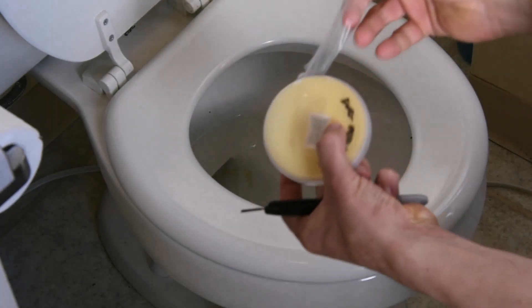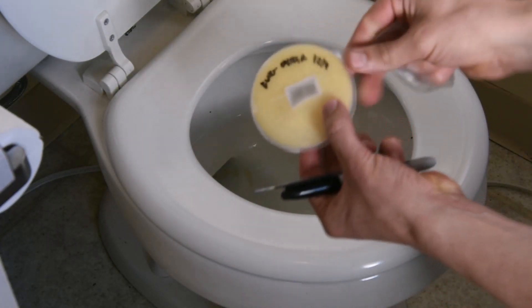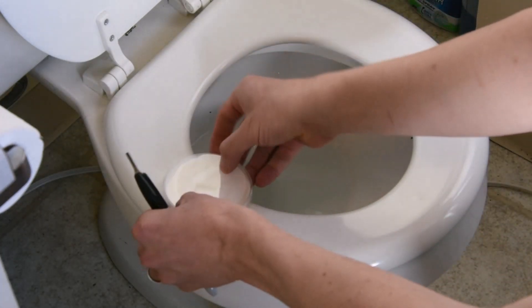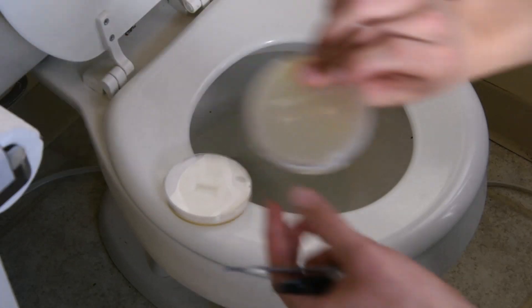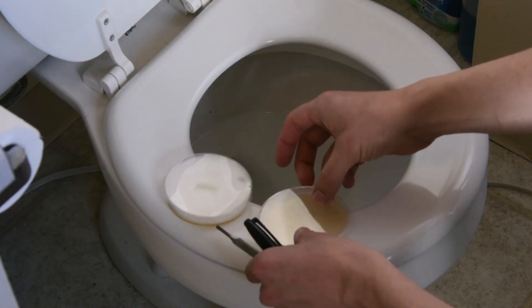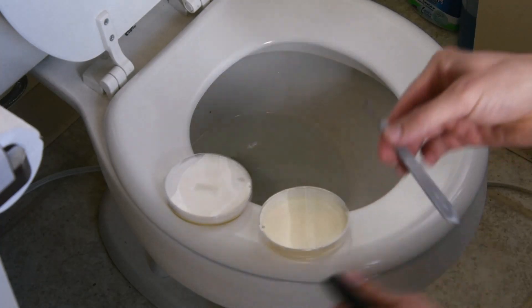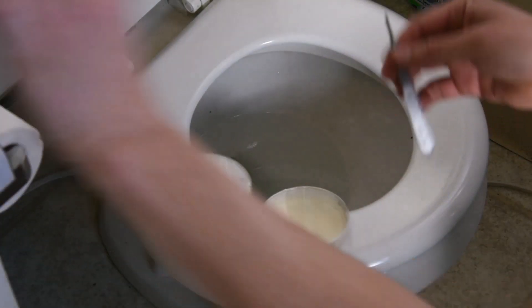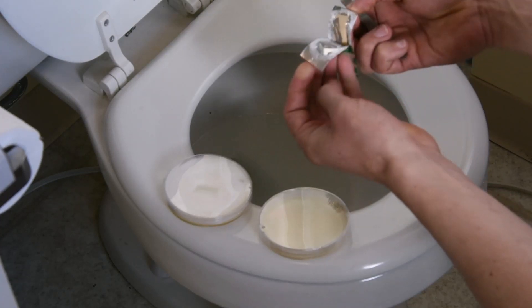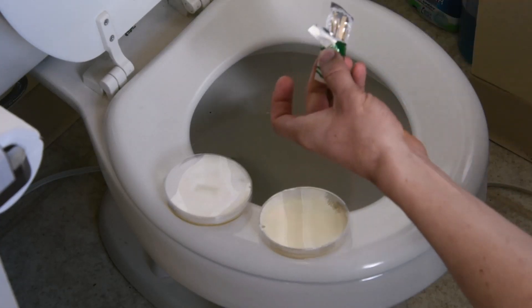King Oyster — what is he thinking? Wait a second. Is that tape on the back of the dish? Oh no, what is he doing? He can't possibly do sterile procedures on his neighbor's toilet. Oh well, we'll see what happens. Looks like he has a handle and a sterile blade. Why even bother? He's opening it right over the toilet? This isn't going to work.